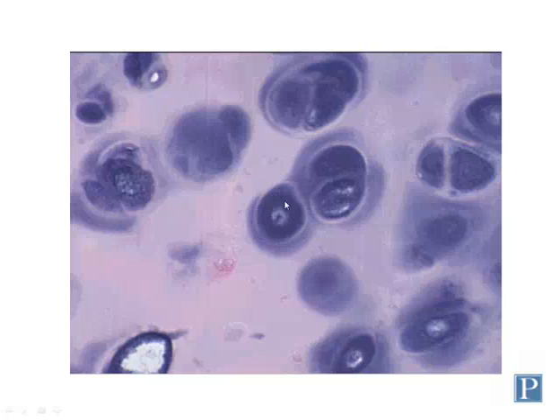So here is a single chondrocyte within a lacuna. Here's a lacuna with two chondrocytes. Sometimes you see multiple chondrocytes within a single lacuna after they've continued dividing, after they've left the chondrogenic zone. Notice that the coloration of the matrix differs depending on the distance away from the chondrocytes. So notice that the matrix immediately surrounding the chondrocytes is a more deeply basophilic color. This is called territorial matrix.